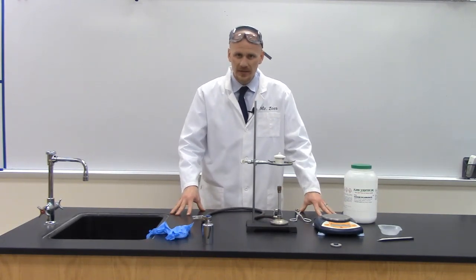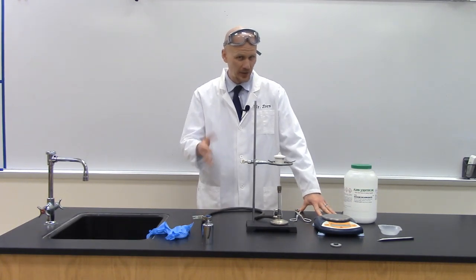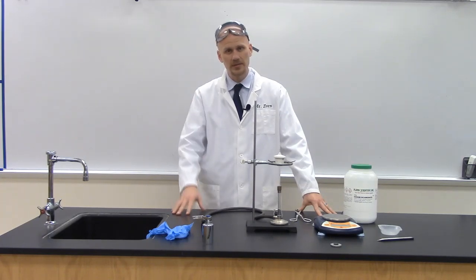Your objective in this lab is to heat sodium bicarbonate, that's the thermal part, and to figure out which of the four given chemical reactions is correct.